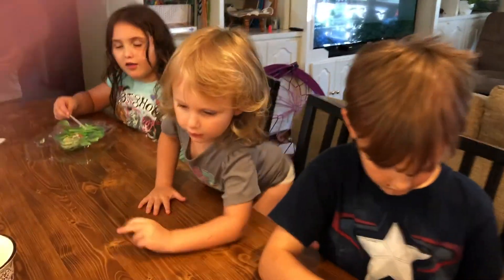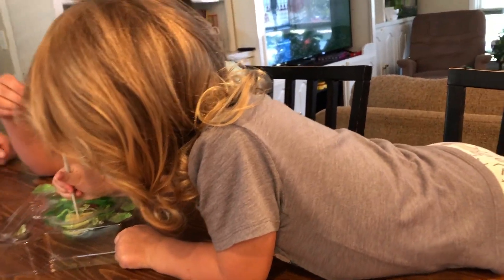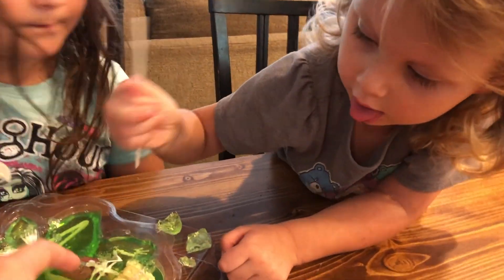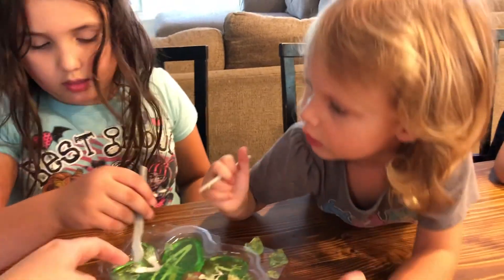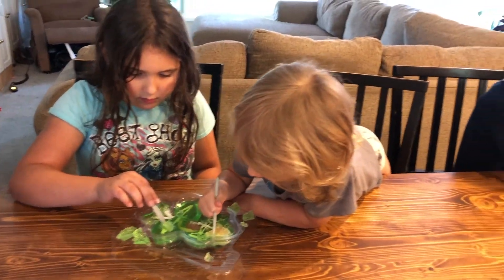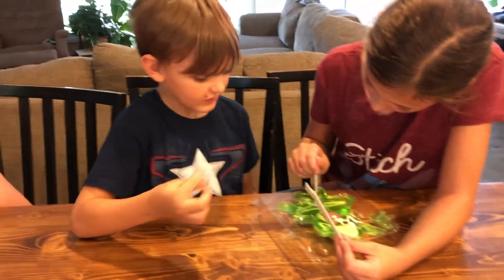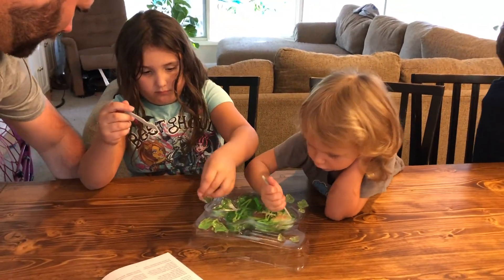Is this edible? No! How's it going? Did you get to any bones yet? Yeah. Did Daddy tell you what the bones are called? So right here we have our humerus — Zoe was talking about how she learned in school where her humerus is. And down here we have the heel. Here's the tibia — this leg part right here. You have a tibia. The big bone in your leg is the femur. He's helping you — this big bone right here is your femur.